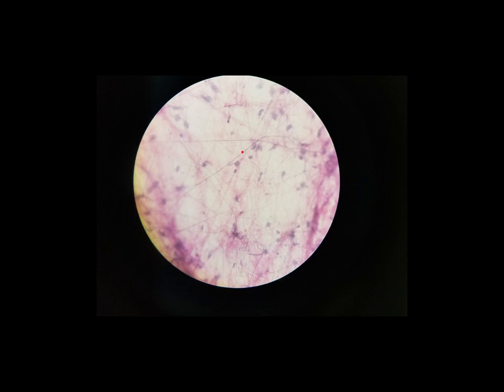These very, very thin fibers that almost look like cracks in the slide or like hair, those are called elastic fibers. And then in this example, they're fainter but thicker, we see running in the background, these are collagen fibers. So collagen fibers, fainter but thicker. And then the dark, thin fibers are elastic fibers. Both of them were made by fibroblasts.